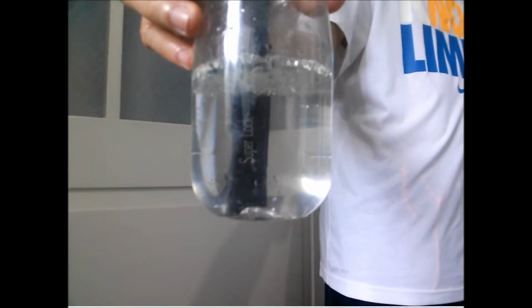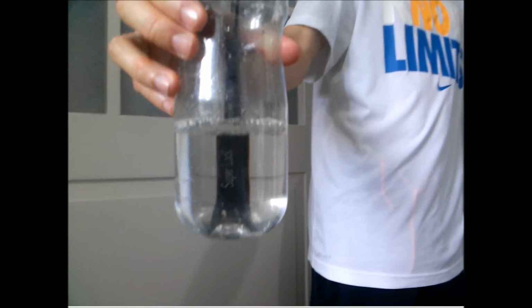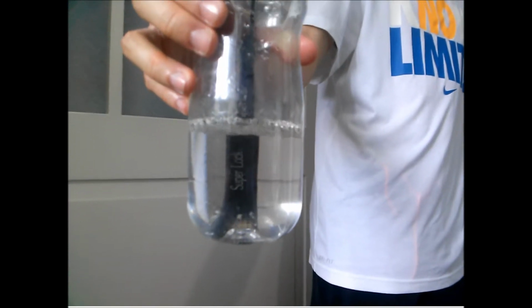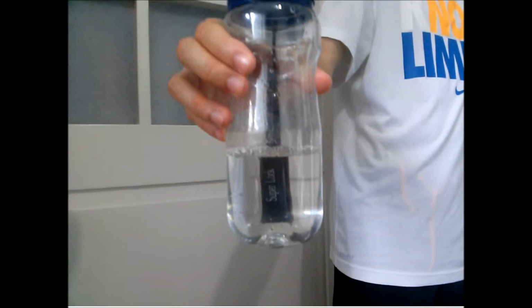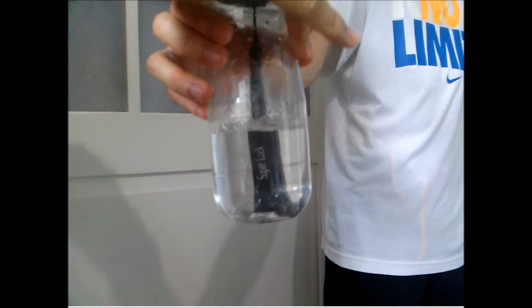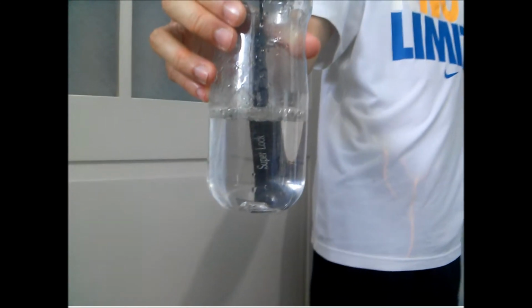Alright, as you can see, the oil has formed a surface near the surface of the water. It's broken down into droplets. Due to time constraints, we cannot show the eventual result of leaving the oil to stand here. But if the oil is left standing with the water, it will eventually form a layer of oil once again.